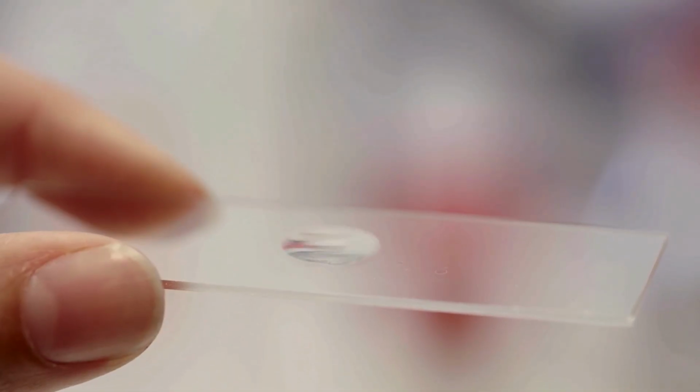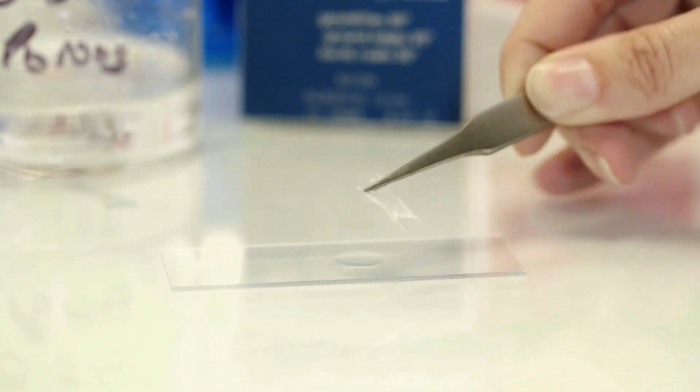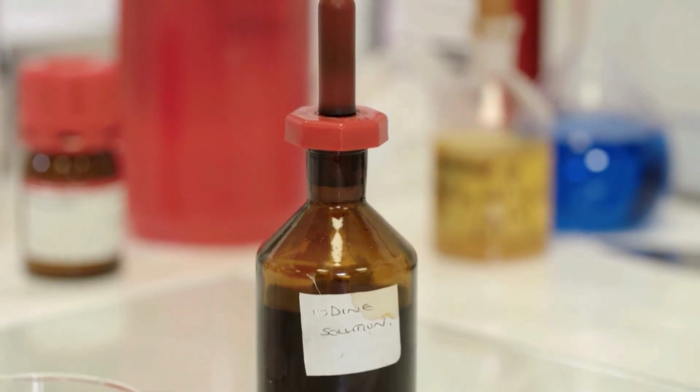Put a drop of water in a slide and carefully place the epidermis. Cover the onion with a cover slip. Be careful so that there will be no air bubbles trapped. It might reflect the light and can obscure the image. Use a filter paper to absorb the excess water.